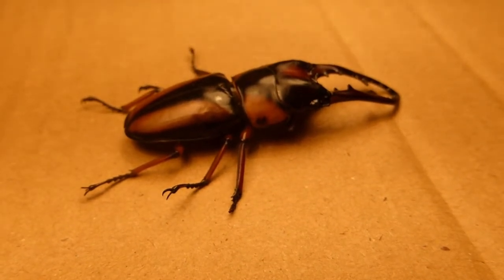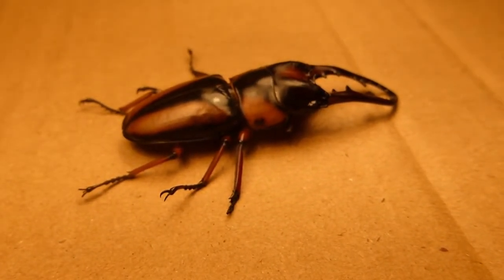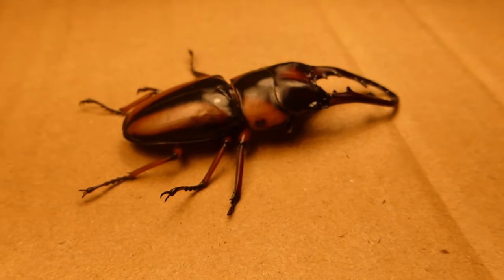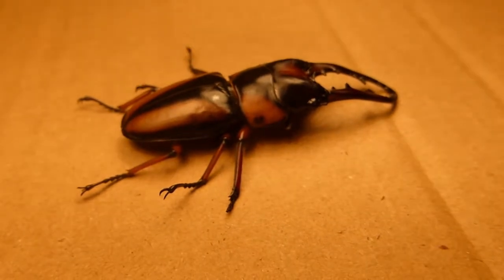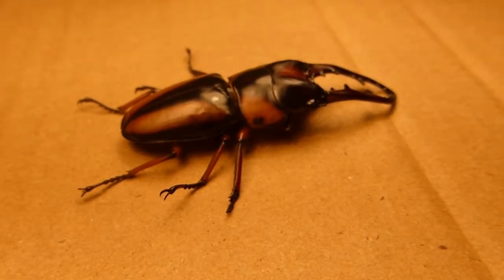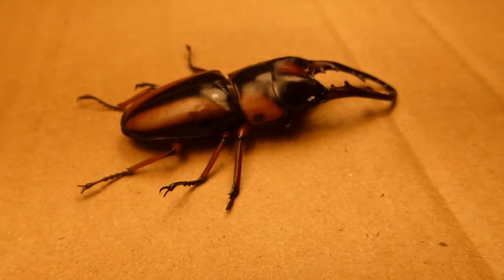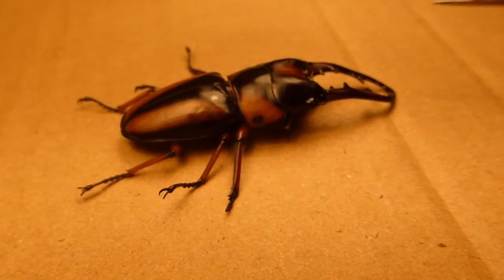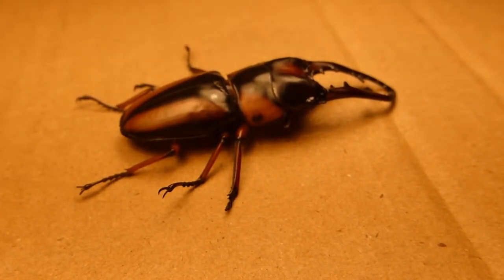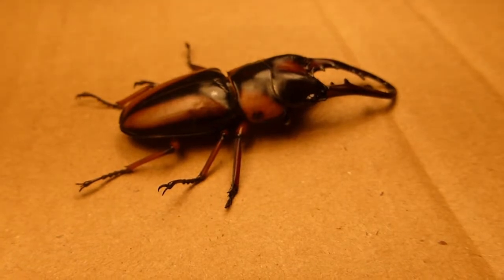The most striking feature of stag beetles is these large antler-like structures here, which is where they get their name. The antlers are used in a very similar way to stags, in that these are used to fight between males for anything from territory to food to mates.